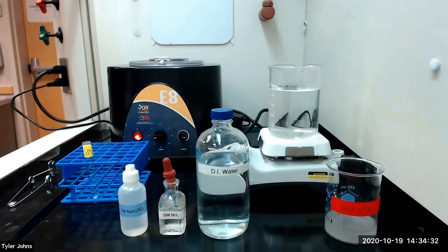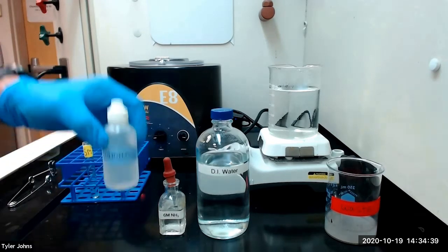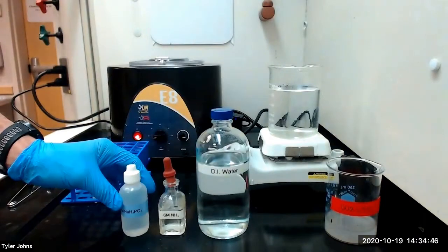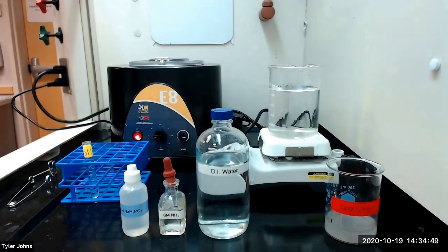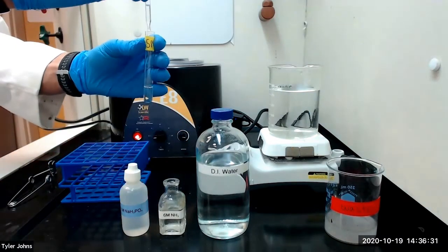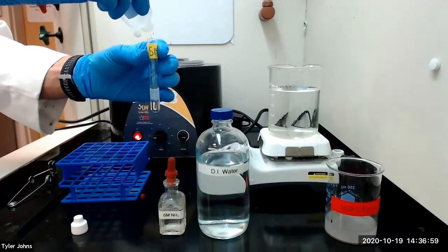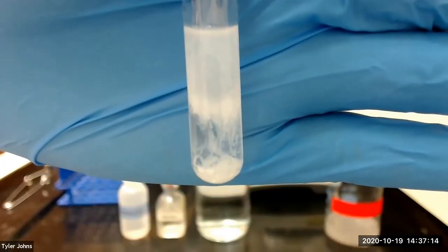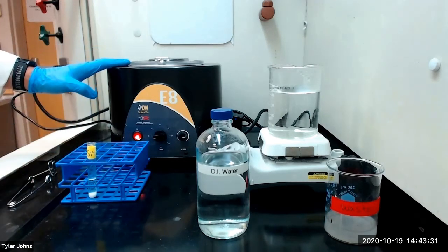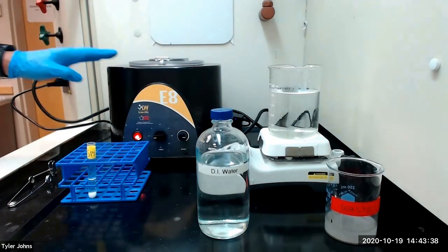We will now perform the test for magnesium ion. To solution S14, we will add one milliliter of six molar ammonia, and then we will add 0.5 milliliters of one molar sodium dihydrogen phosphate, and we will stir for 5 to 10 minutes. A white precipitate of magnesium ammonium phosphate hexahydrate is a preliminary indicator of magnesium. After 10 minutes, we will centrifuge our mixture and discard the liquid. We will then wash our precipitate with deionized water, centrifuge again, and discard the wash liquid.